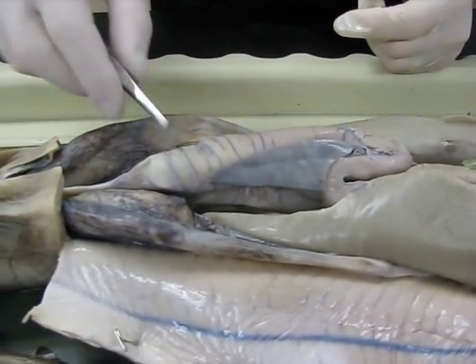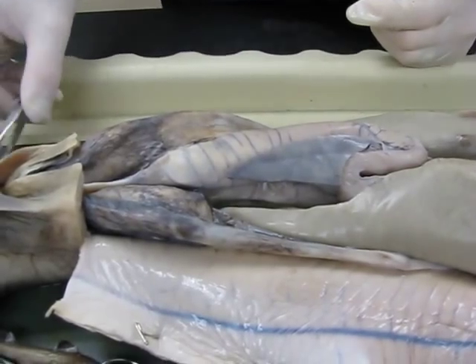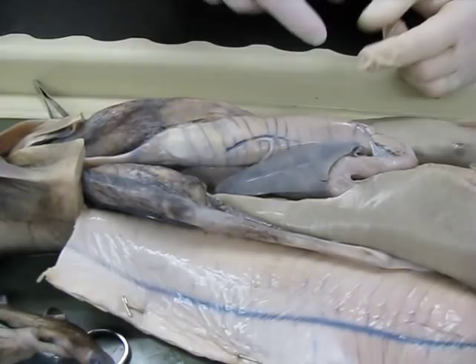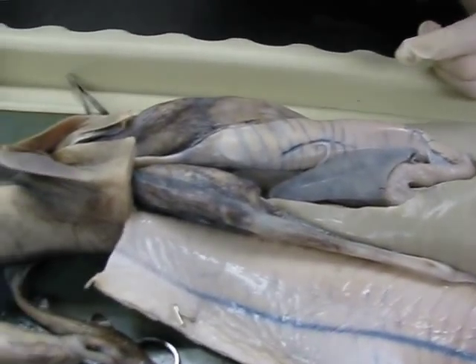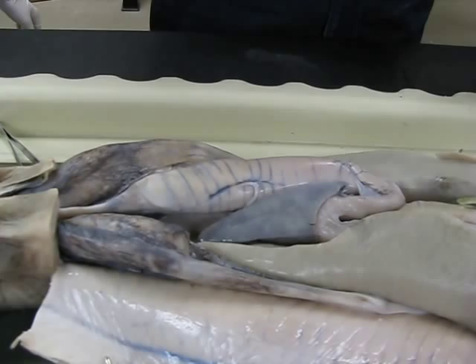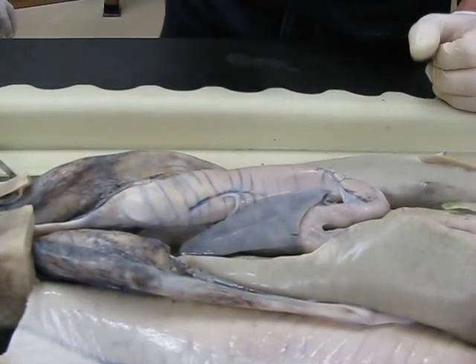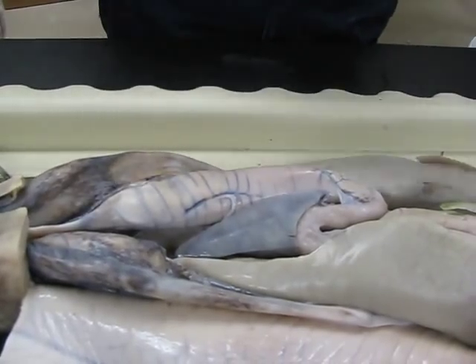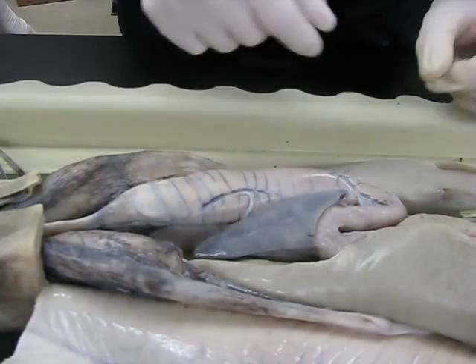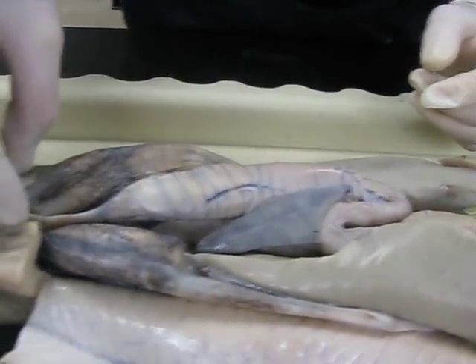Did you cut open your intestine and look at the spiral valve? Not yet. What you see there are these little cross things. If you cut that open and lay it out, what you're going to see is that food has to go around and around the spiral. So what's the significance of that? More surface area. So it slows food down so it can be absorbed as it goes down through the ileum and then it ends up in the colon at the end.